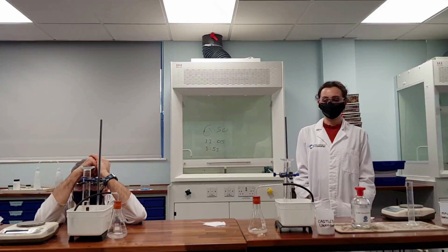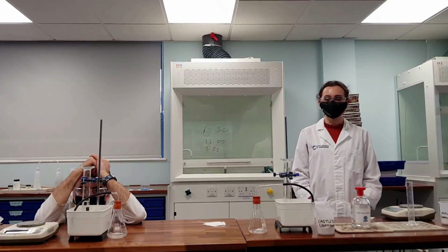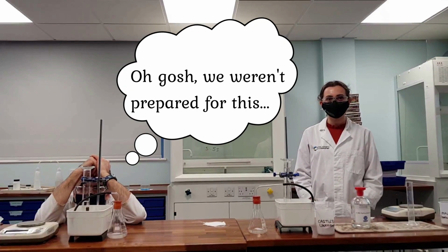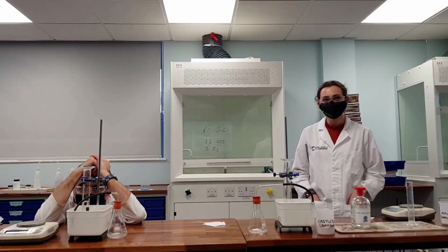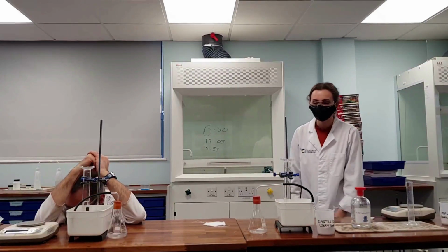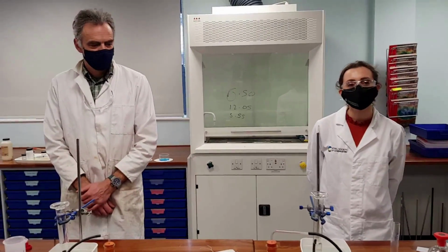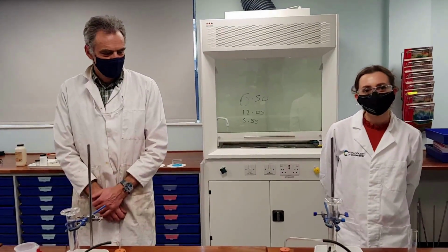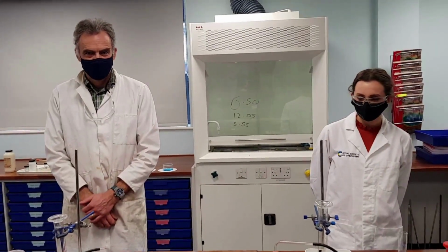Now, Mr. Reeves and Miss Richardson are excellent chemists. So what are they going to do now? Yes, you're right. They're going to repeat the experiment 2 more times to check that they get results that agree. So, Tweedledum and Tweedledee have repeated their experiments. I actually made them do each other's experiments just to check that they weren't cheating.